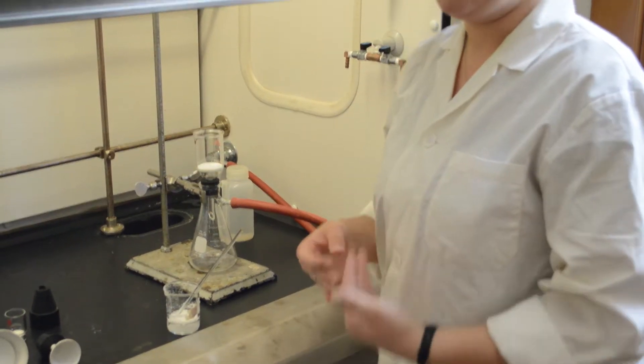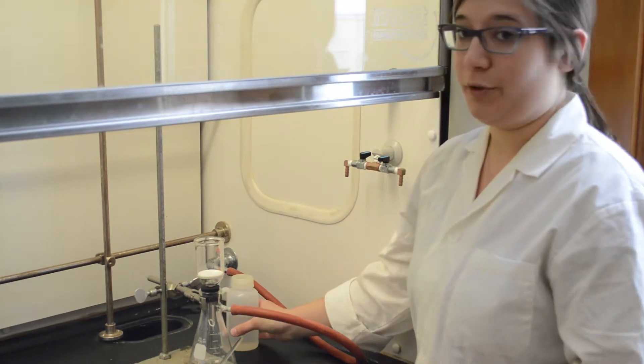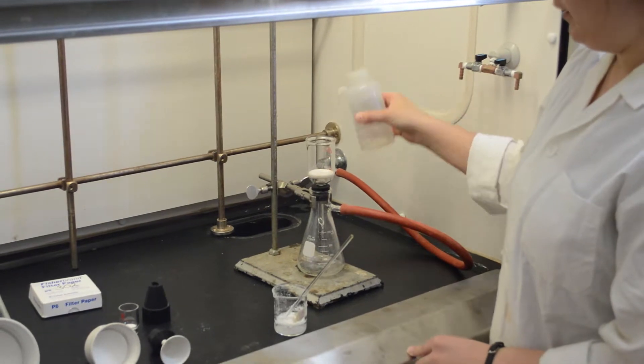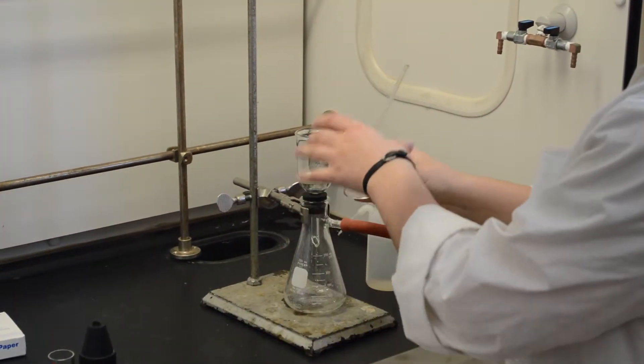Sintered glass funnels are really useful because they don't require the use of a filter paper which may contaminate some solutions. You can wet the sintered glass funnel a little and then pour in your mixture.